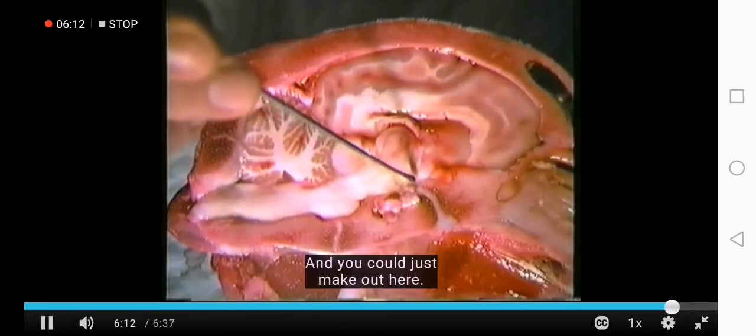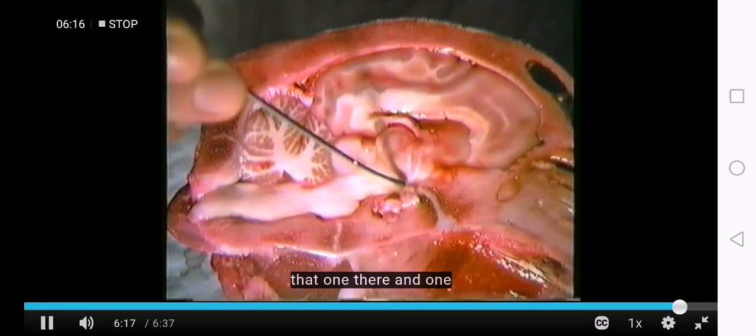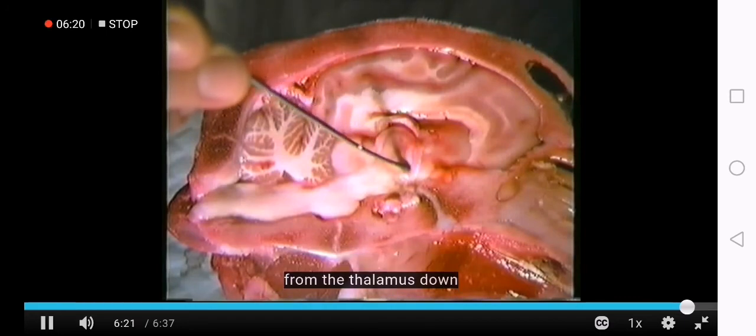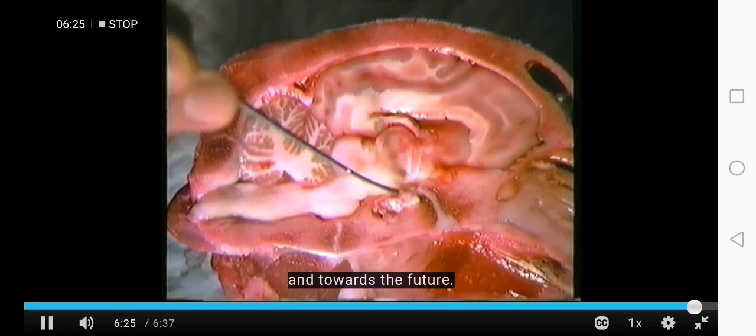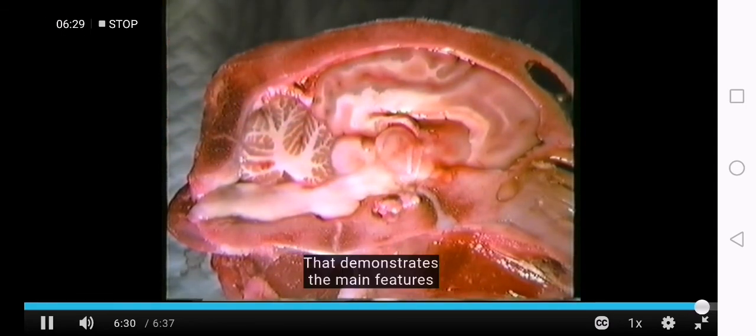And you can just make out here a little band of white matter, one there and one there. And those are myelinated fibres which are going from the thalamus down towards the hypothalamus and towards the pituitary. That demonstrates the main features of the mammalian brain.